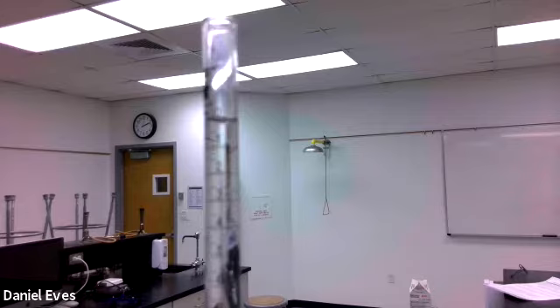And when it turns it pink, then I'll know that I have reached the equivalence point and that the number of moles of base that I've added is equal to the number of moles of acid inside the flask. And at that point, I should be able to calculate the number of moles of the base that are in the solution that I've added. And from that, I can determine the concentration of my sodium hydroxide solution.